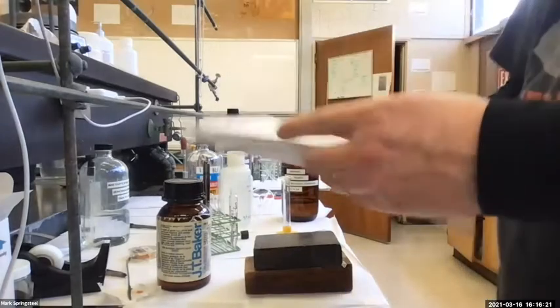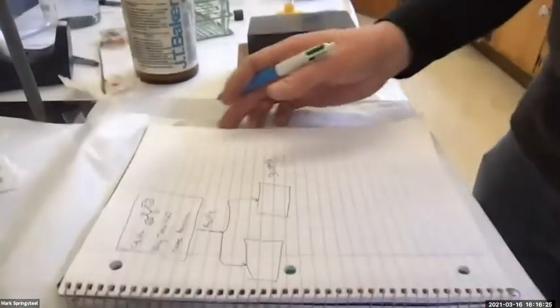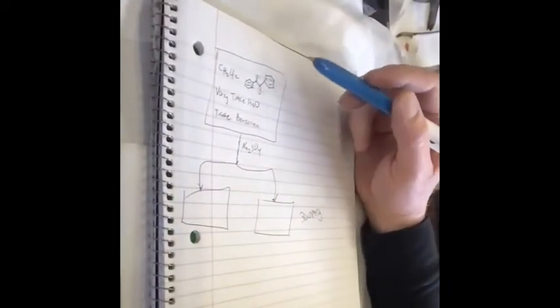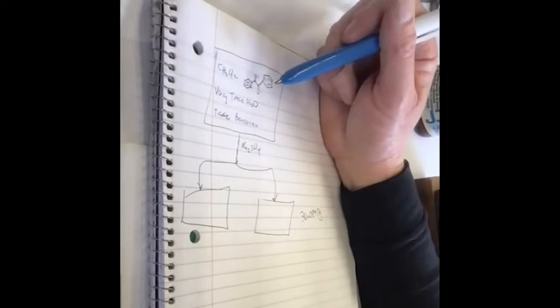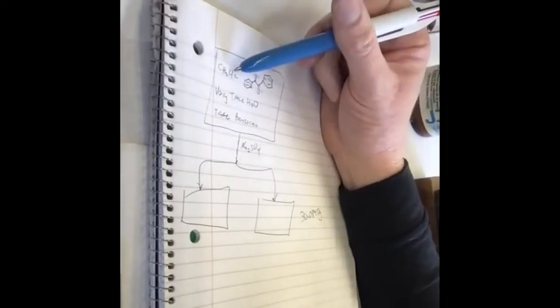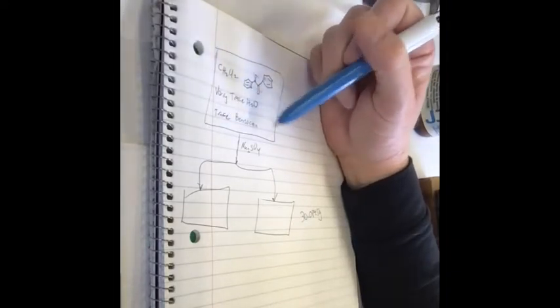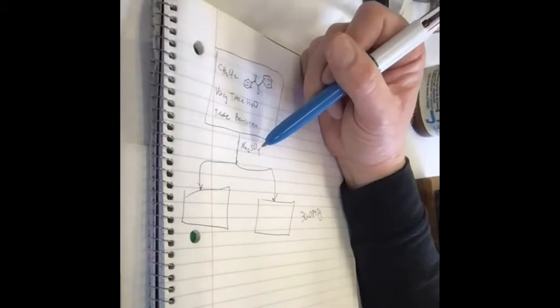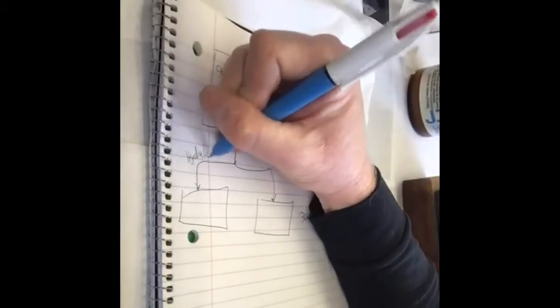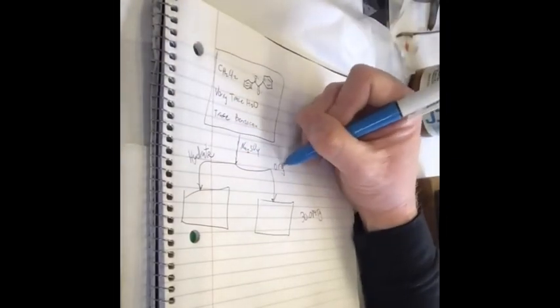Okay, so back to our extraction diagram. This is key to not getting confused because there's a lot of little steps to this. It's easy to mix stuff up. So I redrew my organic layer from the last page of my notebook, and I have the benzil, methylene chloride mostly, very trace water because we did a brine wash, and then just trace benzocaine. I add this anhydrous sodium sulfate, and it creates a hydrate over here, hydrate, and then the organic layer here.